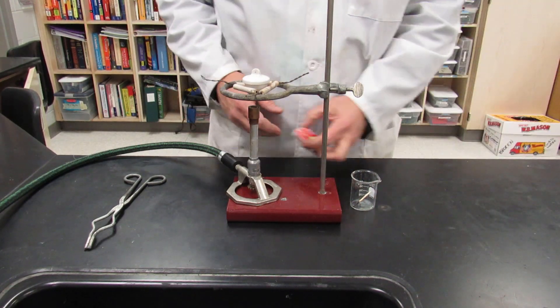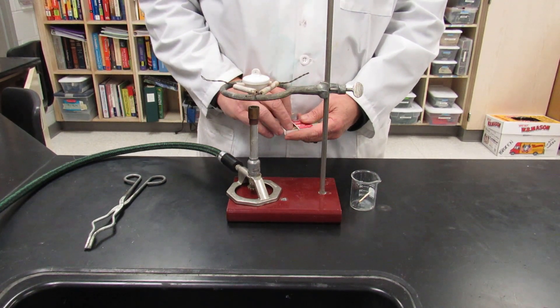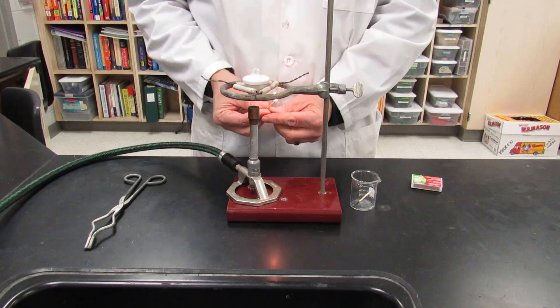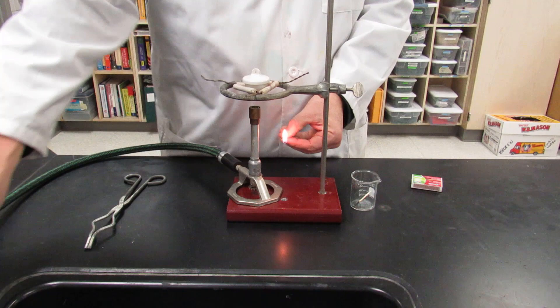Just like the other lab, you're going to want to drive off the water in the crucible. So, you're going to light your match, turn on your gas, turn on your flame.